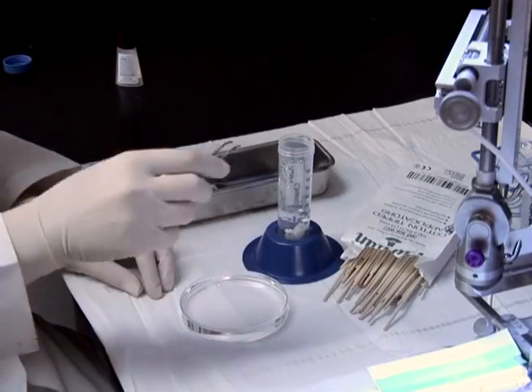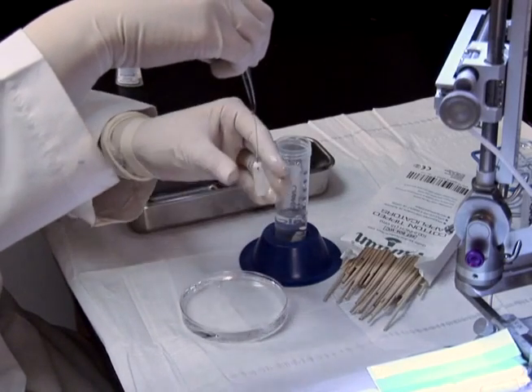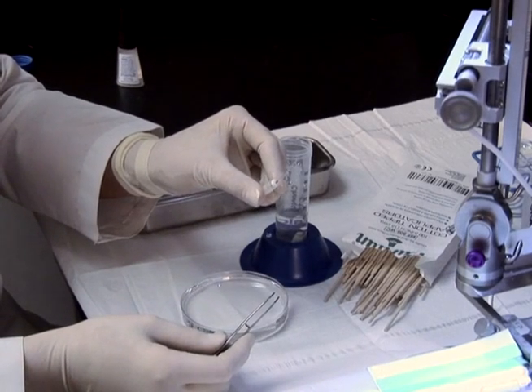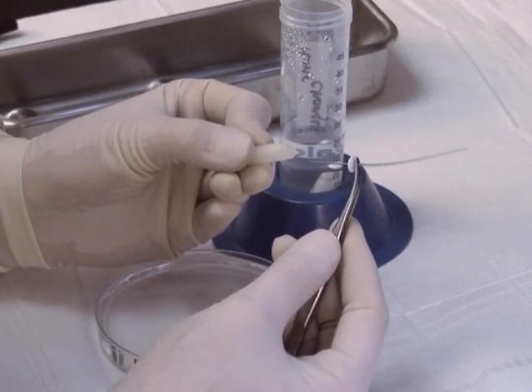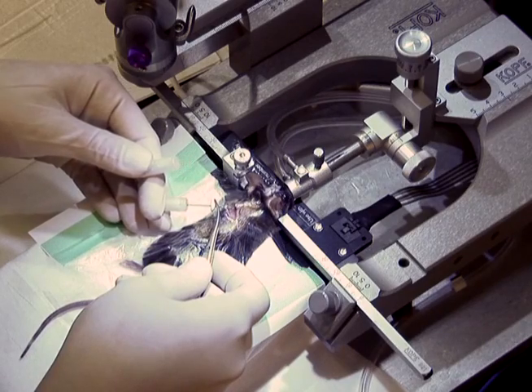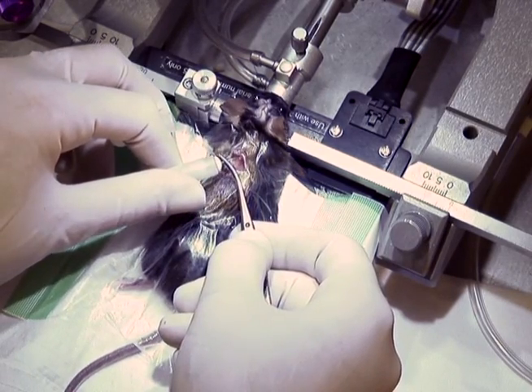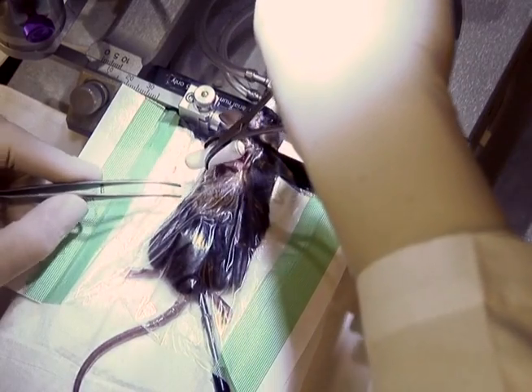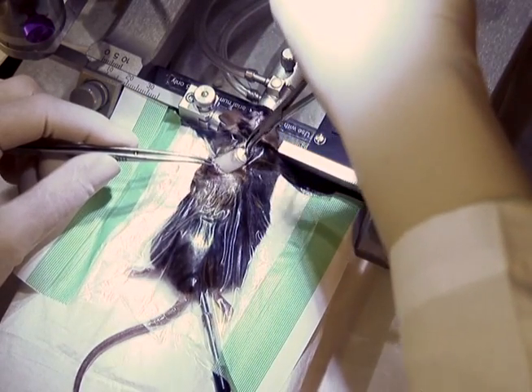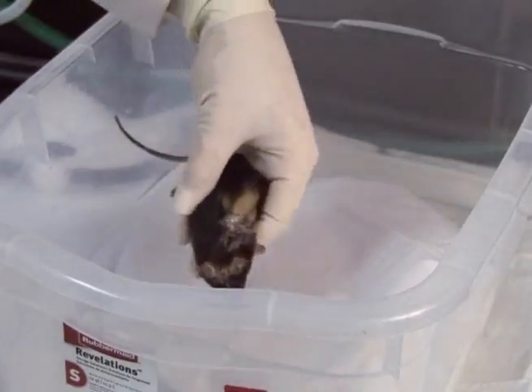If changing the pump, have the fresh pump ready along with a 10 cm dish filled with 95% ethanol. Use forceps to grasp the new pump, then dip the fingers of the other hand into 95% ethanol and take hold of the pump. Discard the new pump flow modulator and carefully pull off the old pump from its flow modulator attached to the tubing and cannula. As soon as the old pump is off, slowly slide the new pump on, ensuring that the flow modulator never touches the outside of the mouse. Reinsert the new pump through the incision back into the subcutaneous pocket and suture the skin. Dab antibiotic ointment onto the wound and place the mouse onto a recovery pad.